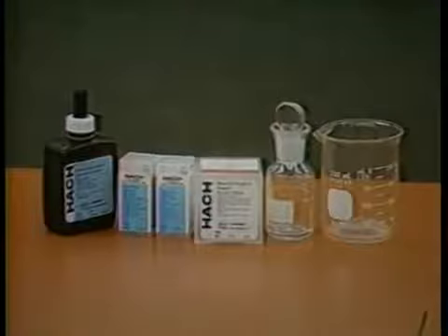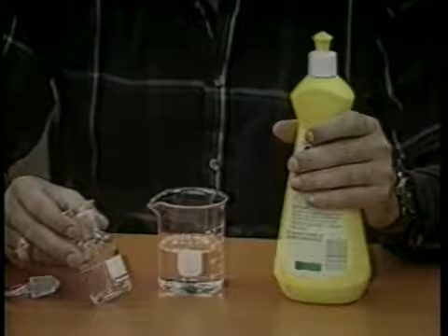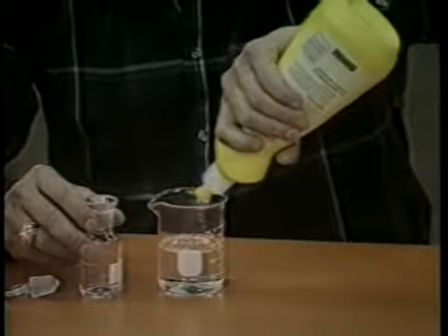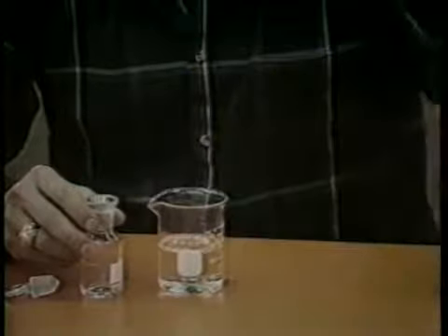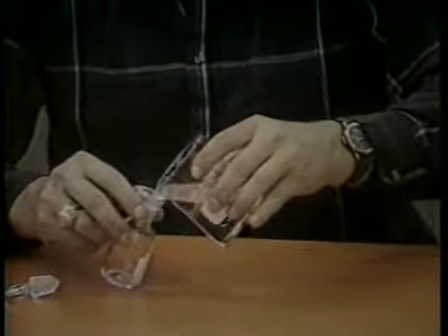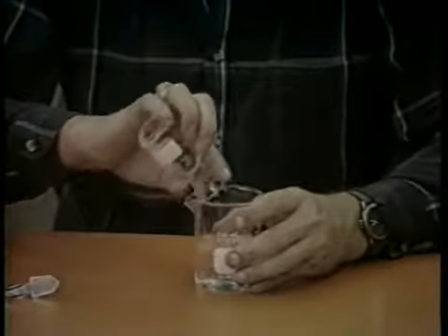To measure dissolved oxygen using the water quality test kit, proceed as follows for the high-range test. Obtain a water sample from the pond by using the glass stopper dissolved oxygen bottle provided with the kit. The bottle should be cleaned before and after each use. To clean the sample bottle, use dishwashing detergent, making sure that it is rinsed well with clean water, preferably distilled or tap water.